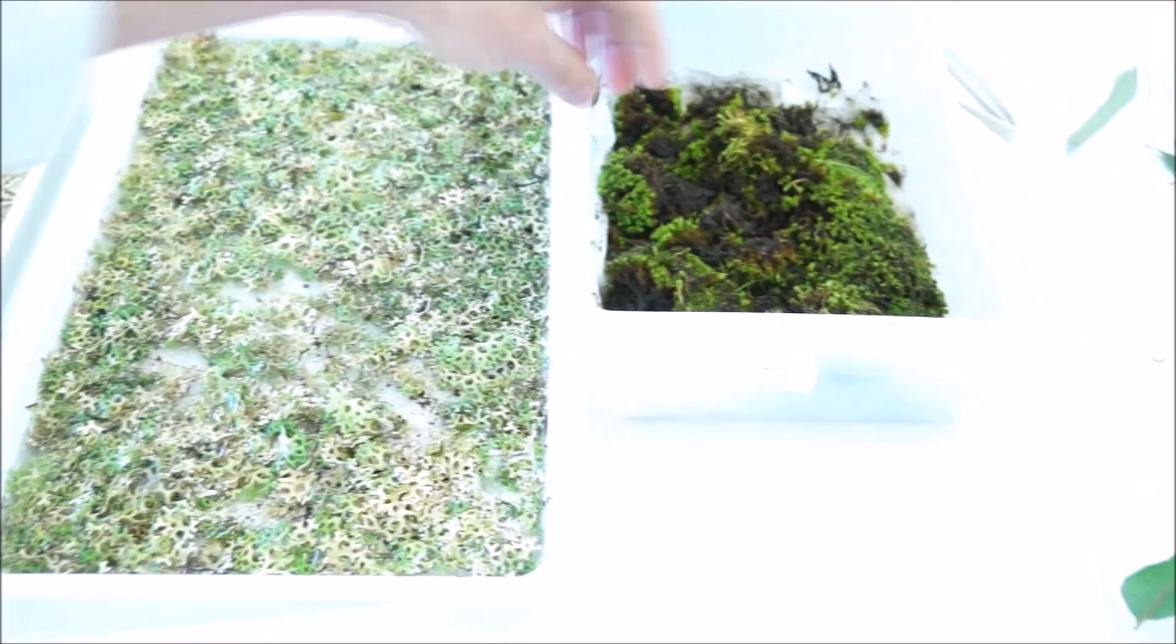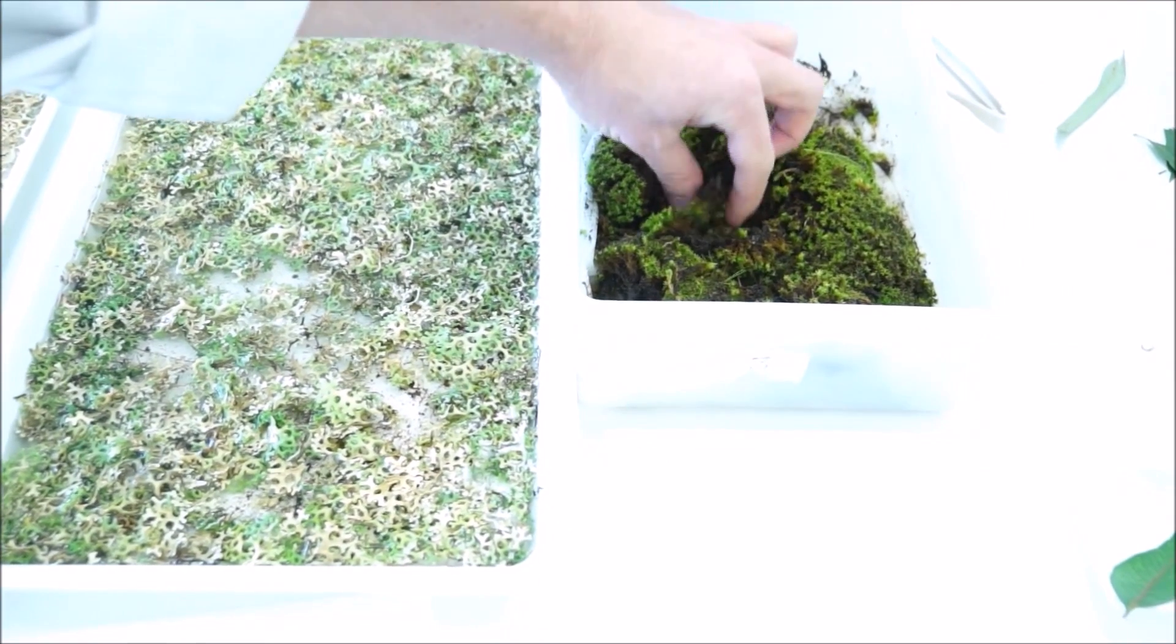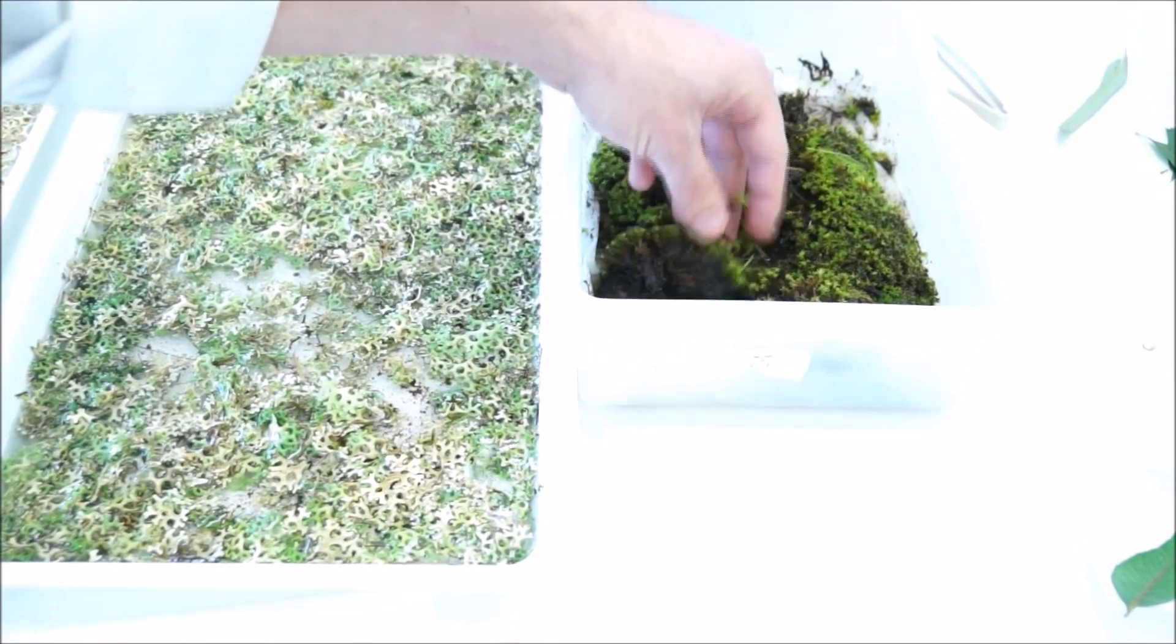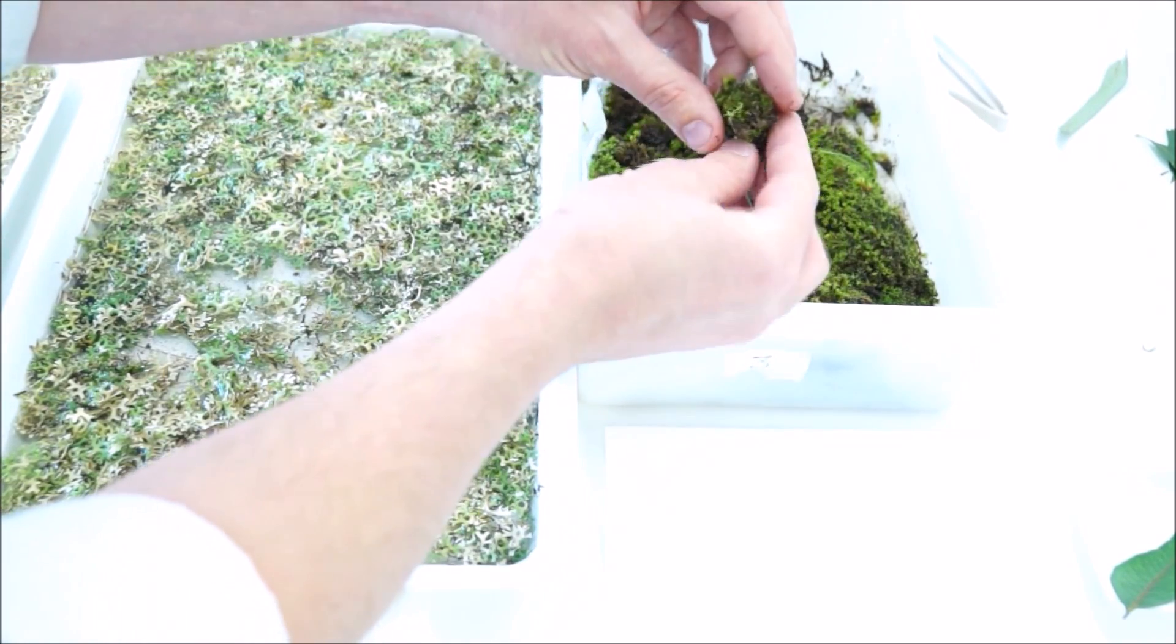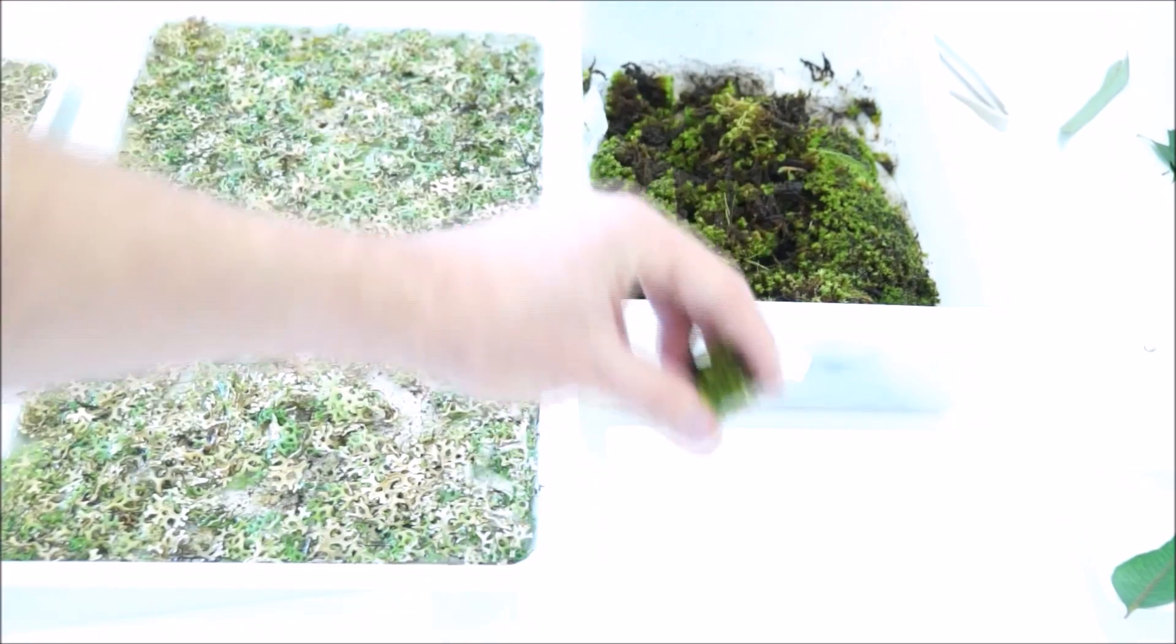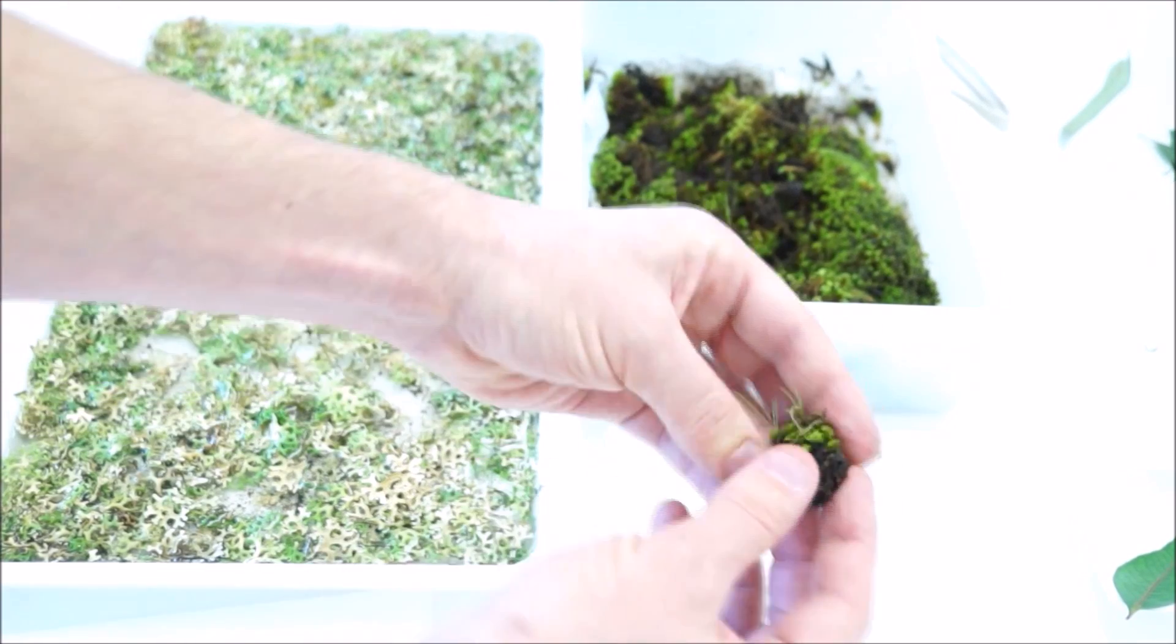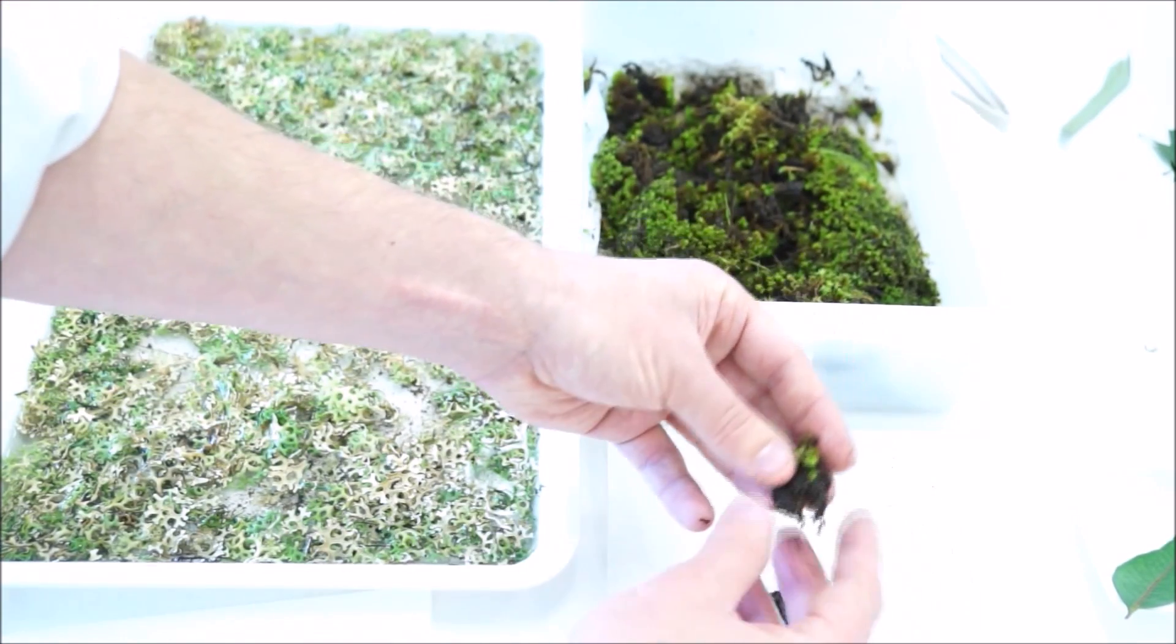The moss is next door here, and the thing with moss that you've got to remember is that it often comes with associated dirt. I'd just get maybe a 10-cent piece worth and pull off as much of the dirt as possible.